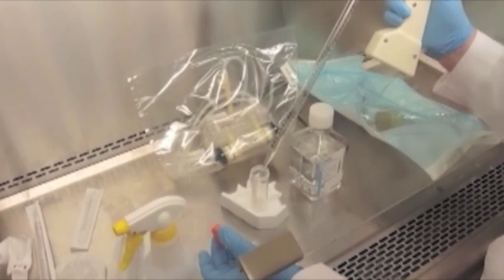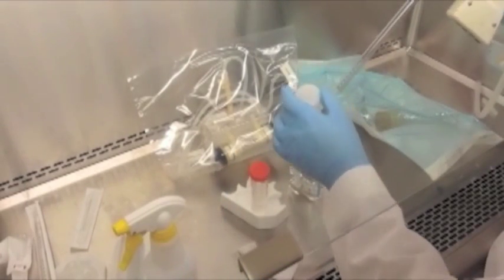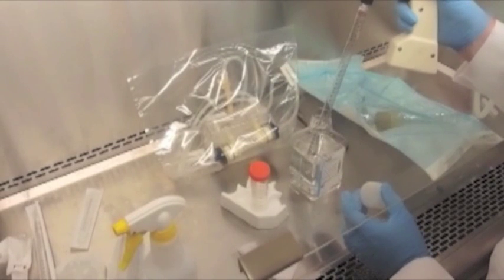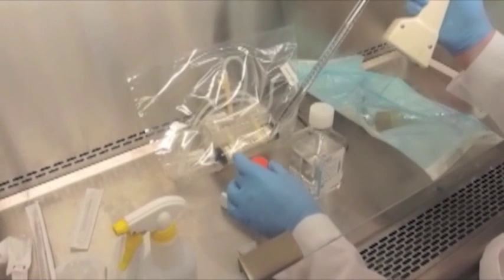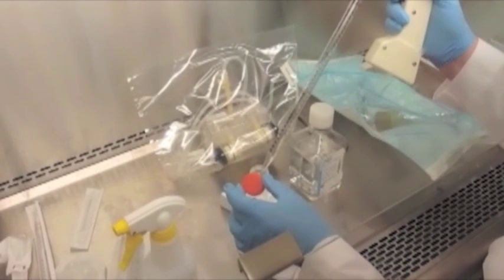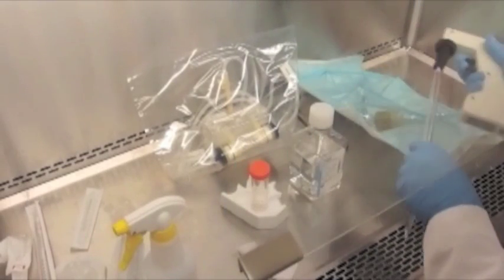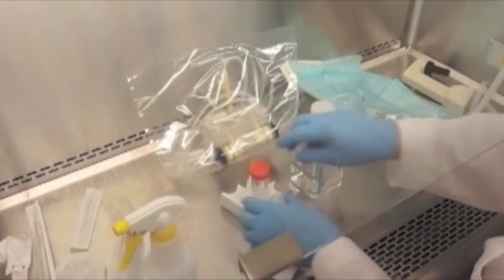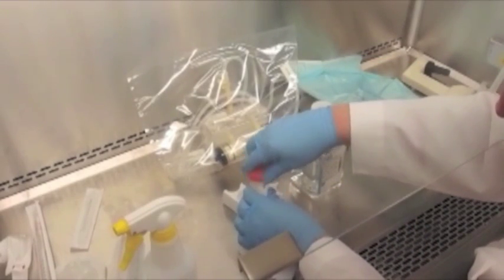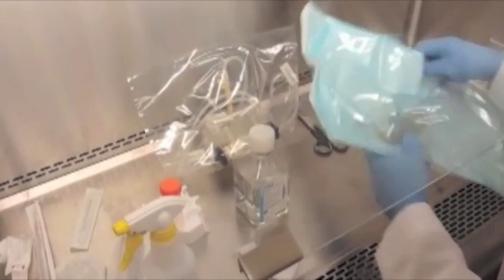The pre-culture is intended to condition the cartridge, equilibrate the fibers, and cover up all the charged sites with protein. We're going to do first 24 to 48 hours of PBS, followed by one change of media without serum, and then one change of media with serum for a minimum of 24 hours. At the PBS stage, we can allow the cartridge to pre-culture for as long as required, 24 hours to several days if necessary.